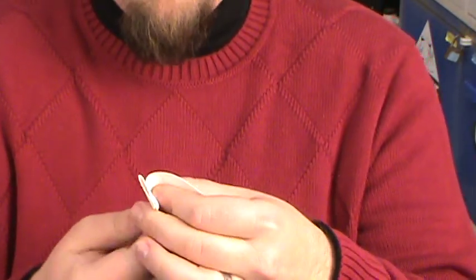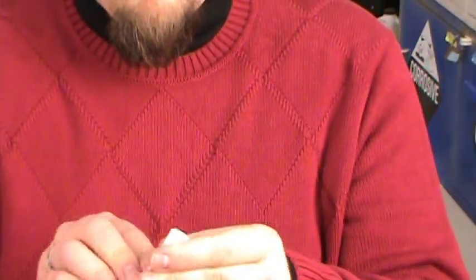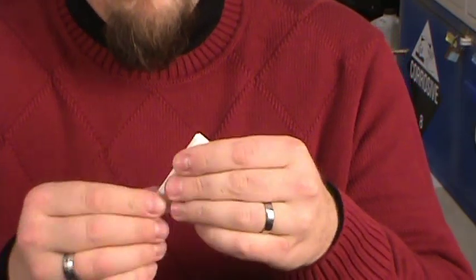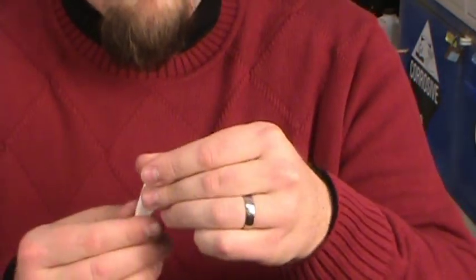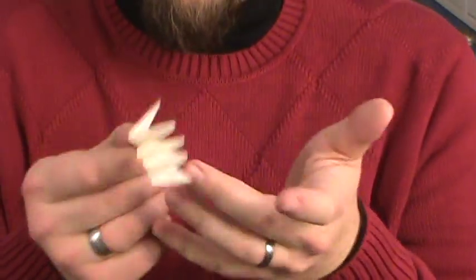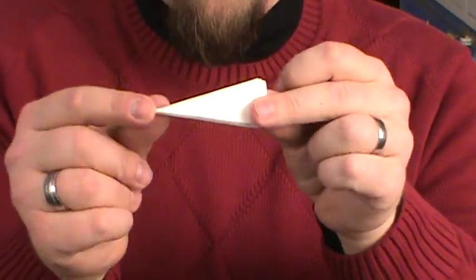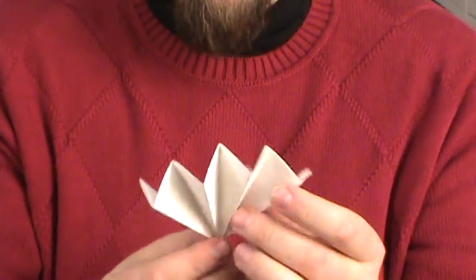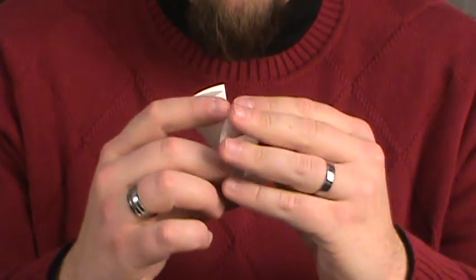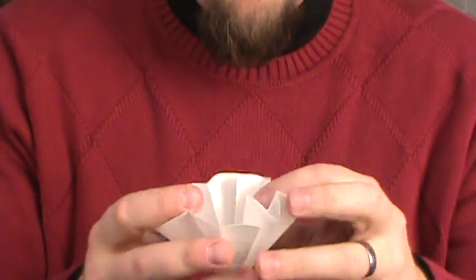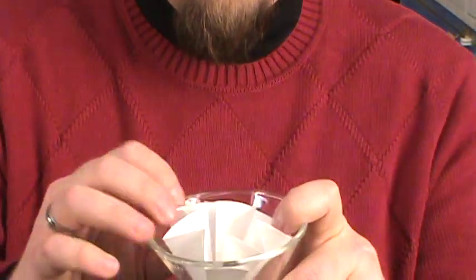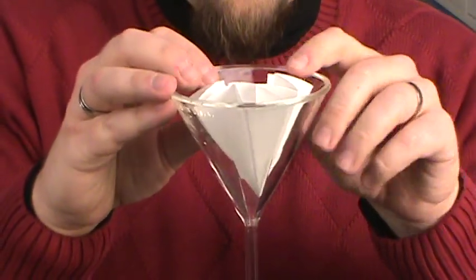Don't worry if it doesn't line up exactly - that's not really that important. So now I've got this little triangle of filter paper. If I spread that open a little bit, looks kind of like a little fan. I can open that filter paper and now those flutes will allow this to sit once again down in a glass funnel. And again it's going to pop up a little bit.